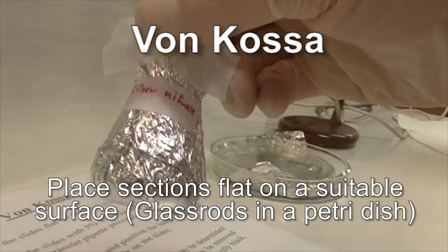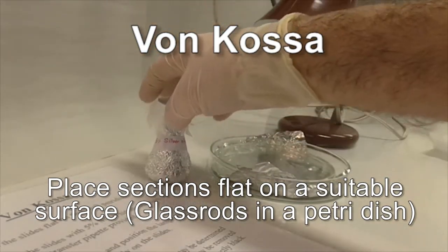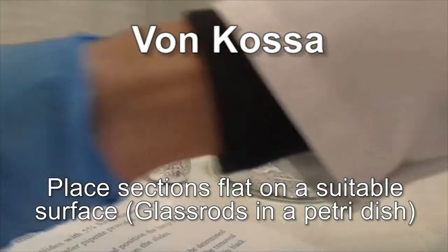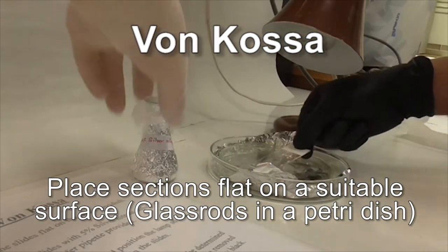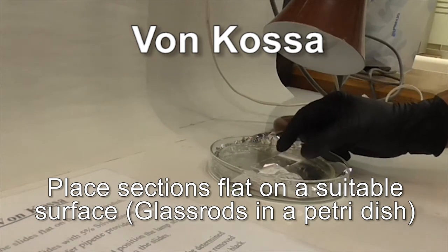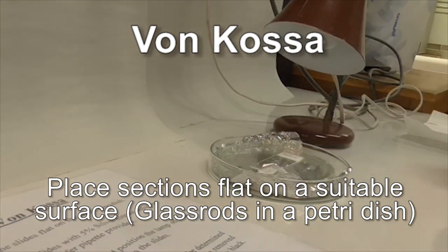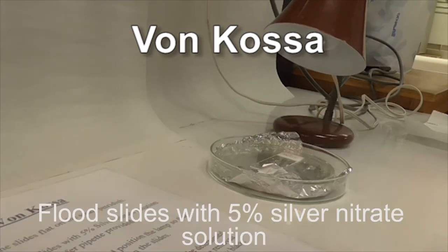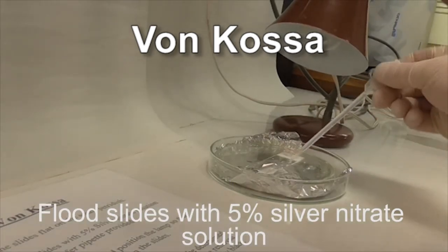Place a section on a suitable petri dish or a glass rod with foil underneath. We will be using a silver nitrate solution. To make this, place 25 grams of silver nitrate in 500ml of distilled water to make a 5% silver nitrate solution.